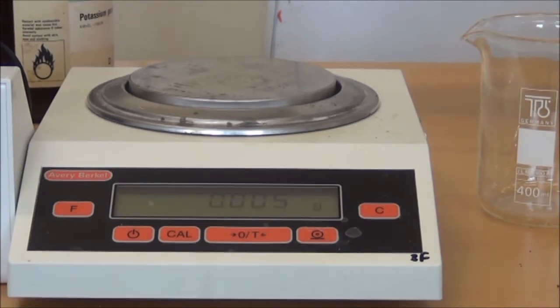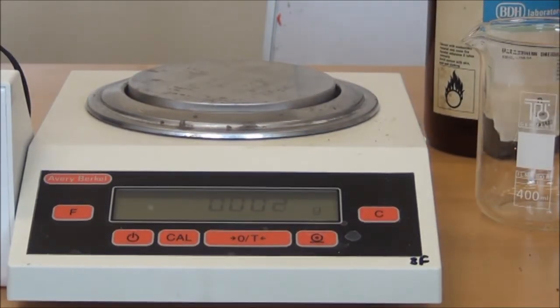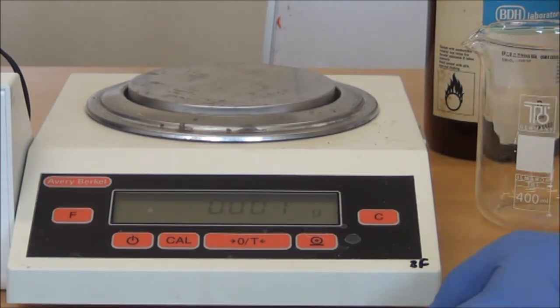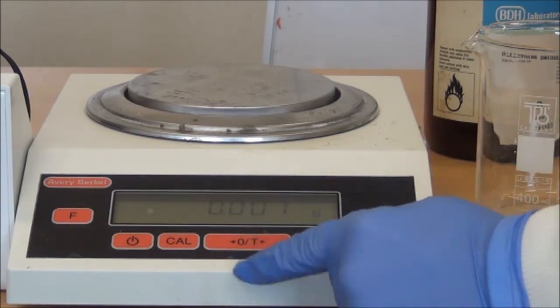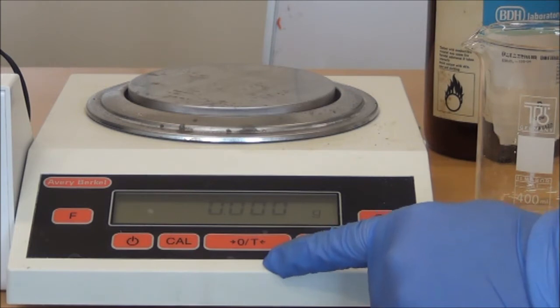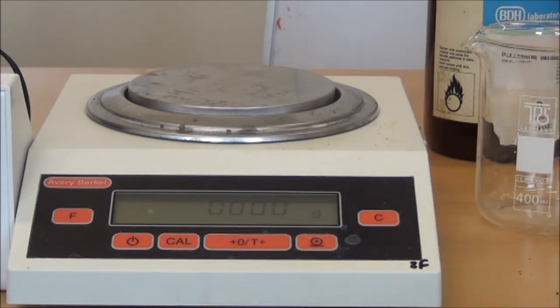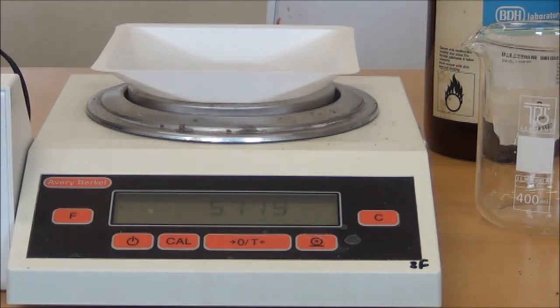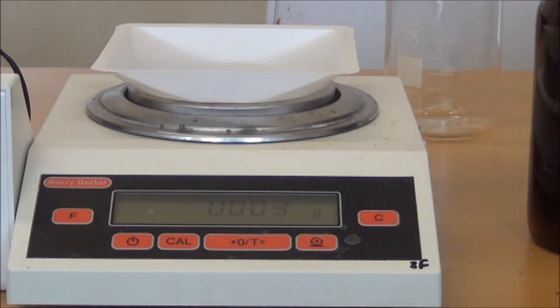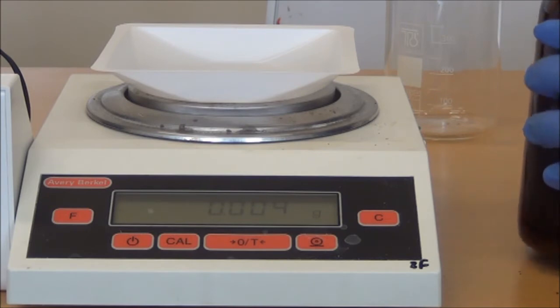So we're now going to weigh out the potassium permanganate, and you can see that we're using a balance. All balances have similar functions. One of the most important ones is this one here, which is sometimes called the TARE button, T-A-R-E, or 0. In this case it's a 0 TARE button. And this is when we can place a weighing boat onto the balance and set the mass to 0, which then allows us to weigh out our solution of potassium permanganate. So bear with me while I do this.